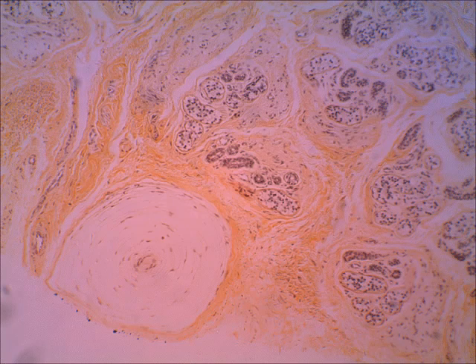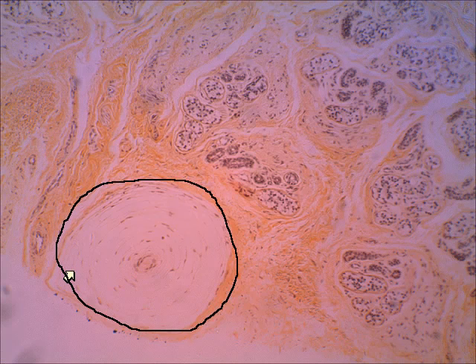There it is. If you look right where the arrow is, all of this area, this is pretty large. All of this is a Pacinian corpuscle. It's sensitive to deep pressure and to vibrations. It can be found deep in the skin. So like if you had a blood pressure cuff on, that pressure is activating Pacinian corpuscles. You also can see these in some of your deep internal organs, like in the pancreas, the liver, the spleen, and the walls of the digestive tract. So because of that, you can feel pressure in those organs, also vibrations. This is sensitive to minute vibrations.